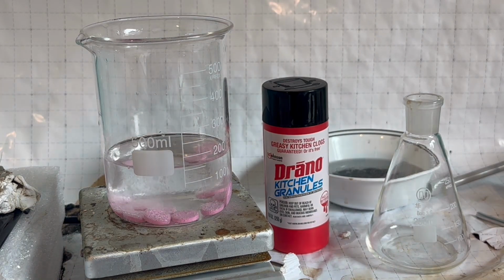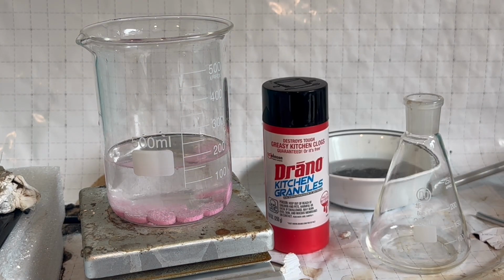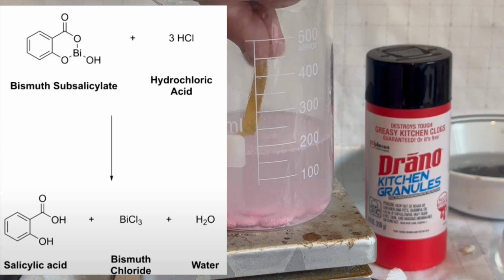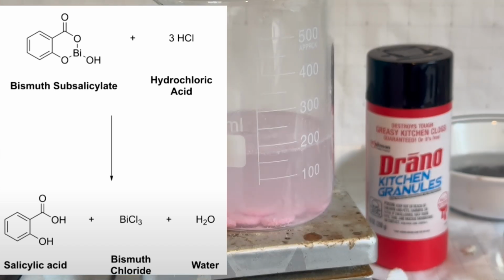The bubbling you see here is due to calcium carbonate, which doesn't produce bismuth. However, the reaction of the bismuth and the acid is definitely happening. The reaction that occurs here is between bismuth subsalicylate and hydrochloric acid. It produces salicylic acid and bismuth trichloride.